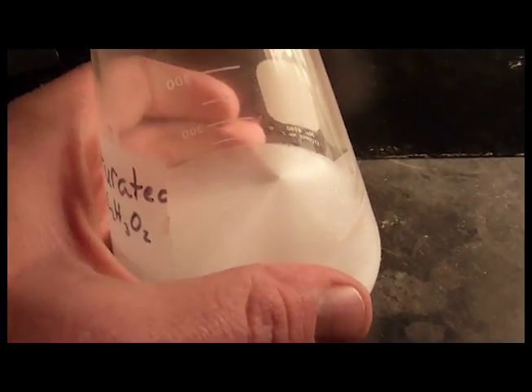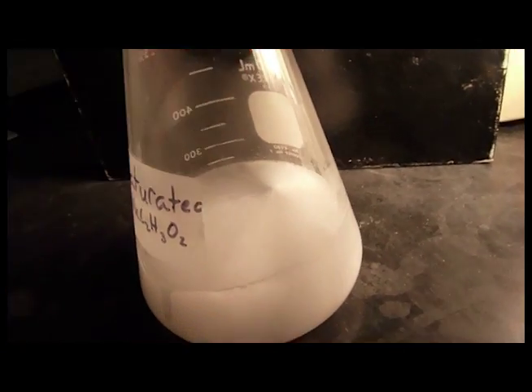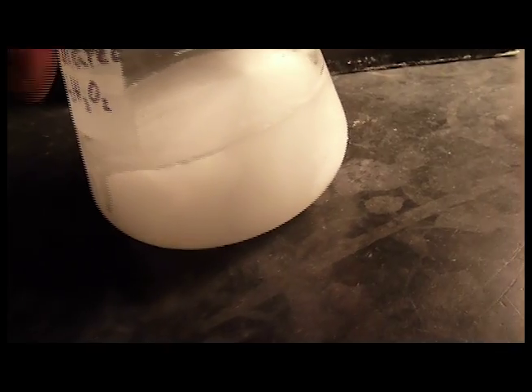What you can't see is that this is actually very warm. The first response of many of my students when they see this reaction, they say, oh, it froze, and they feel it, and see that this process is actually quite exothermic, just to give dramatic effect.